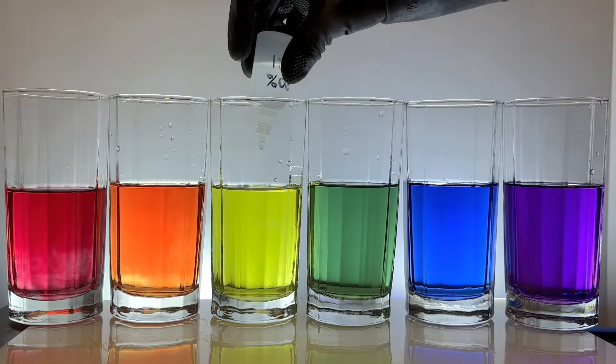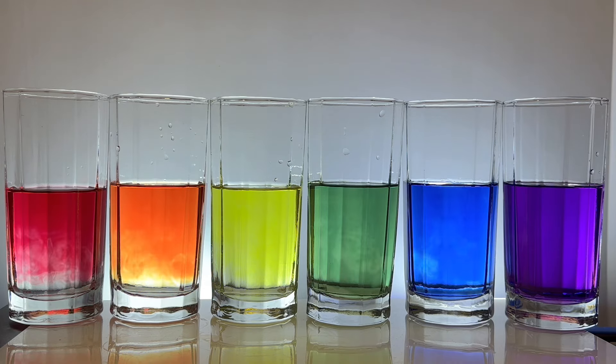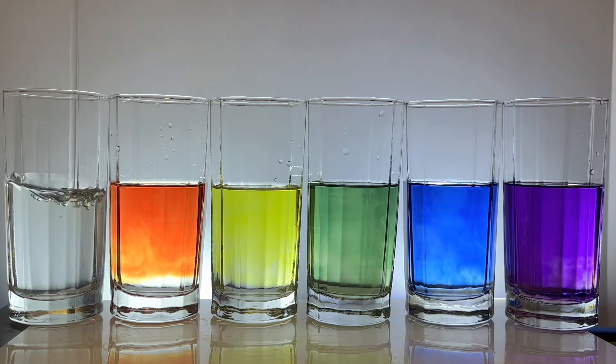For a final experiment, let's just add a few drops of acid to each of these containers, mix up the contents a little bit, and watch the magic happen.